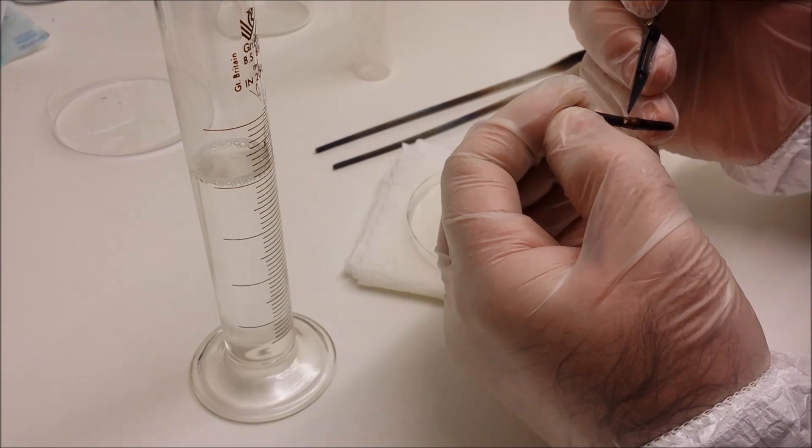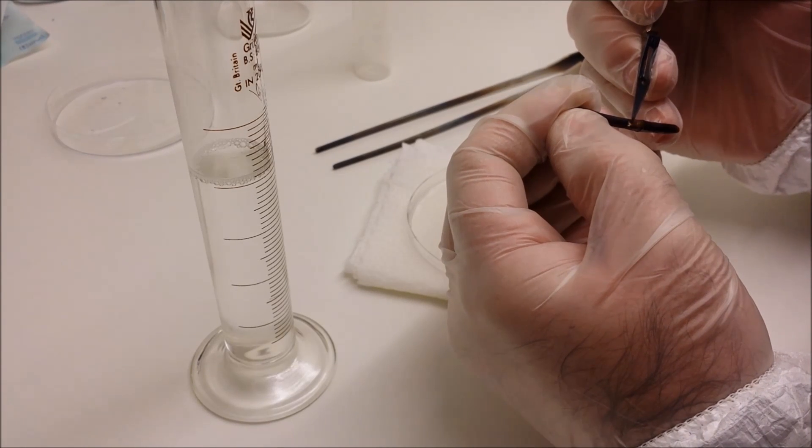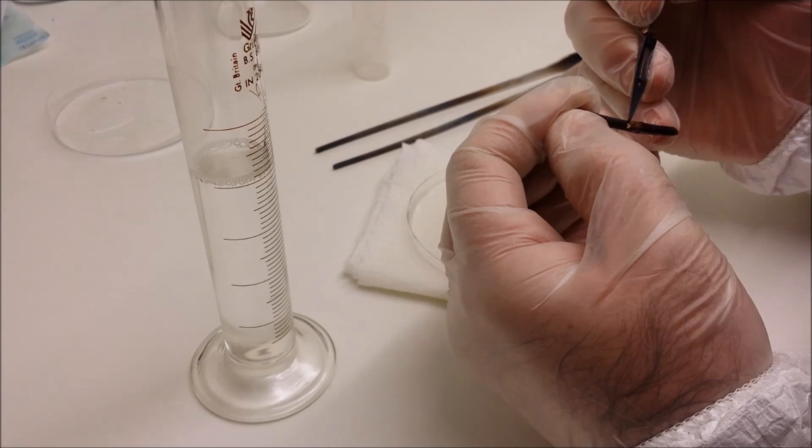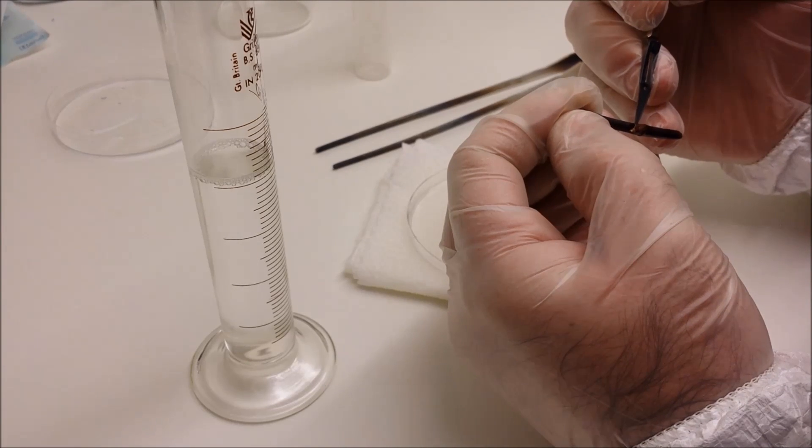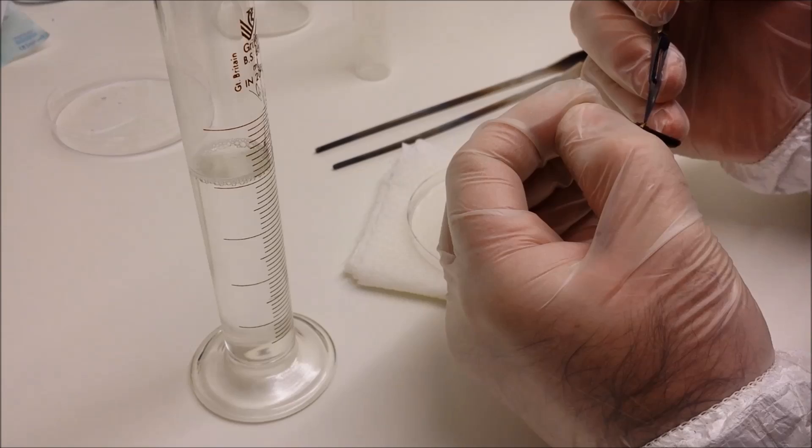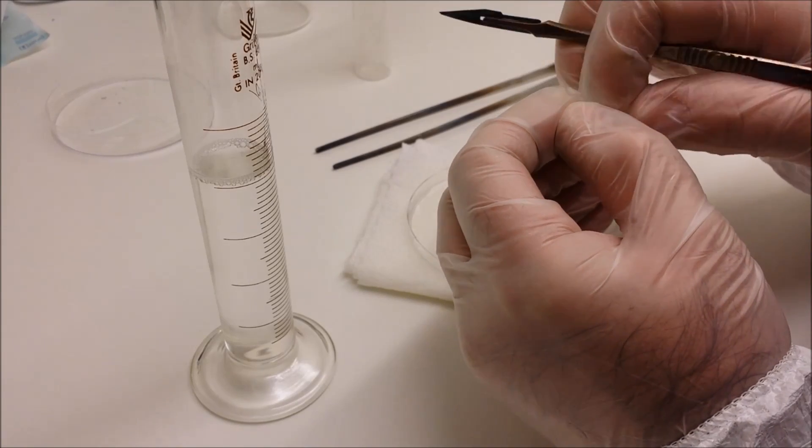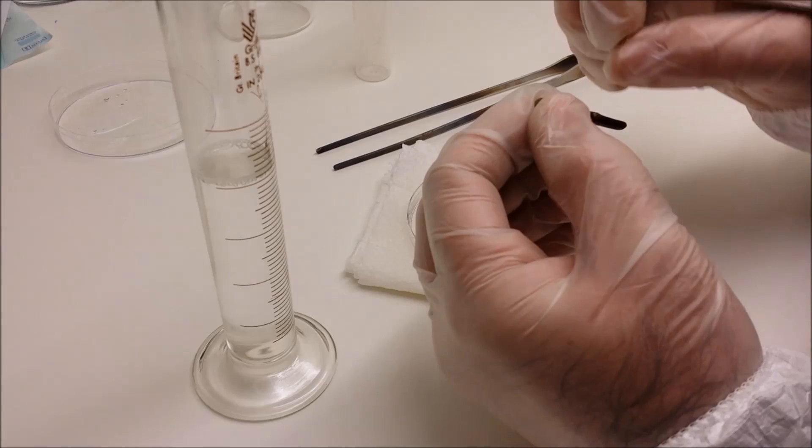You have to be very careful when doing this because if you damage the bud underneath, the game's up and you have to scrap that one and start with another one. So take your time, be as delicate as you can.